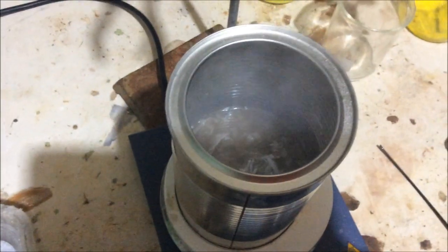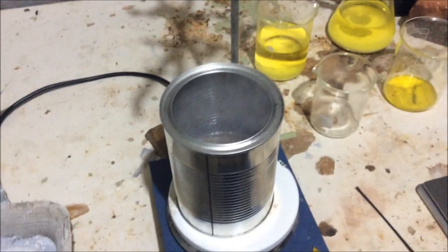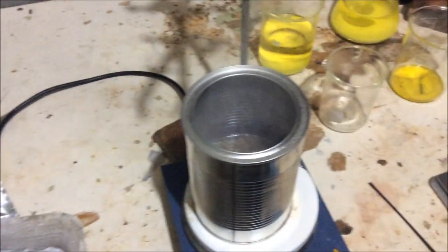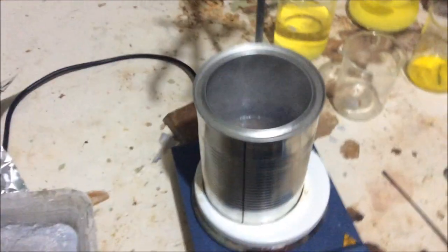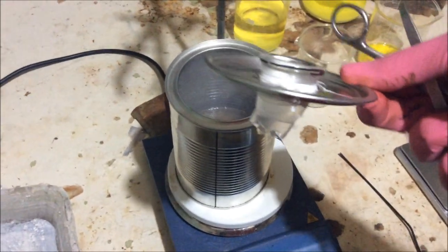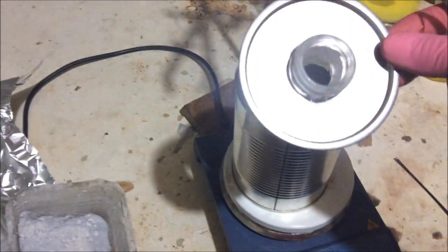We're about half an hour into the reaction. It's been smoking quite a lot. It's a weird reddish brown color. The blue coloration left after about 10 minutes. The blue coloration of ethylene glycol. There's definitely the smell of burning and melting plastic, which is quite unpleasant.